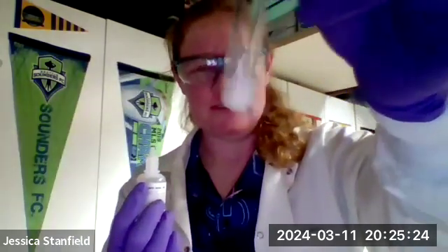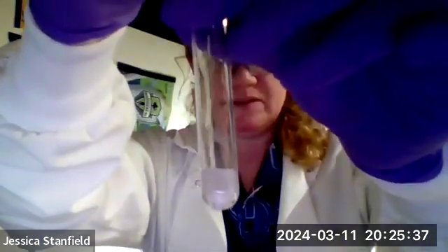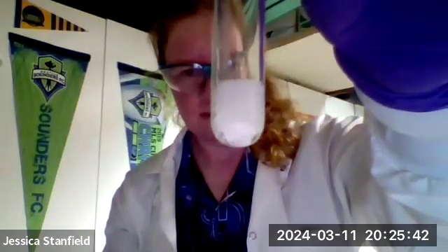So yes, the solid piece of marble and an acid do react with each other. This will keep going until the stuff in the acid is consumed, and then I would have to add more. Hopefully you can hear a little bit of that too. I don't know how sensitive the microphone on my laptop is. Okay, so that's our calcium carbonate with some hydrochloric acid.